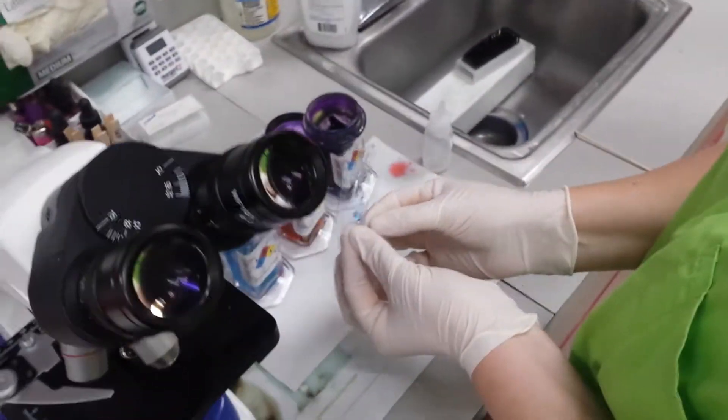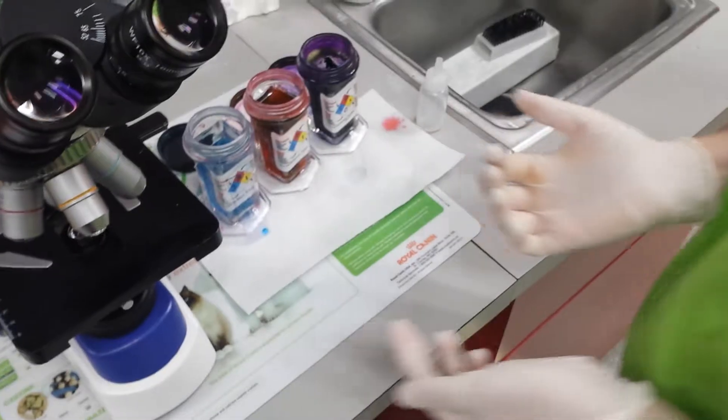Then we're going to rinse that off, and then we're going to place our slide butt down so that it can dry. Once it dries, we'll go ahead and take a look under the microscope.